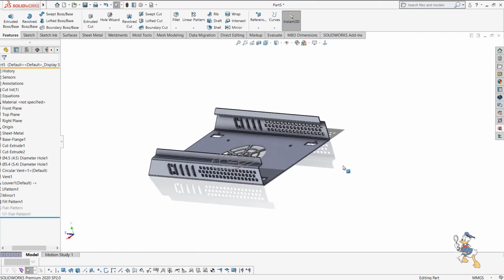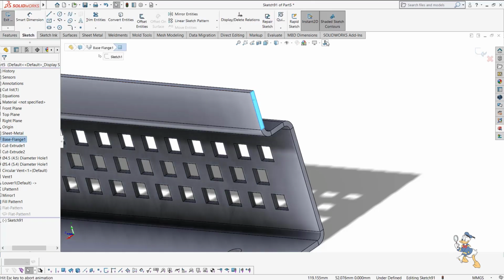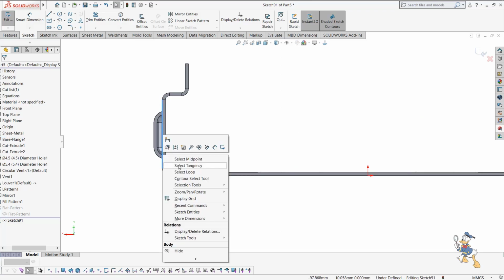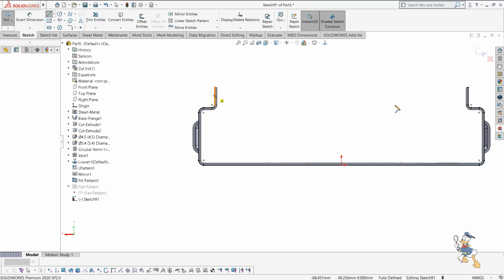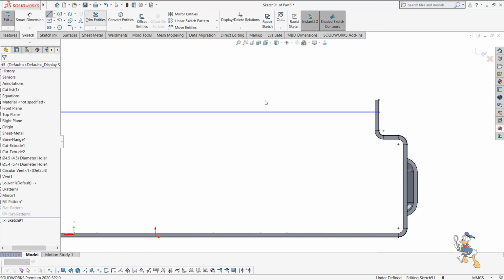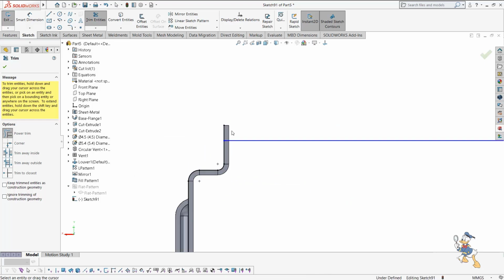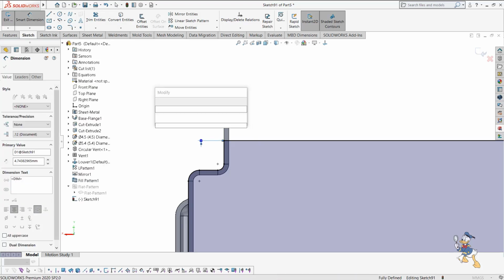And one more thing, if we need to connect some sheet metal to another sheet metal plate, like I need to cover the back side of the plate, it is very easy to design, because it is also a multi-body feature provided by SolidWorks. So I just need to select the tangency. I'm using some kind of shortcut to generate this stuff. It makes it easy, and it is a very less time-consuming process, so that's why I'm using it on a regular basis. And SolidWorks is very flexible for shortcuts as well.